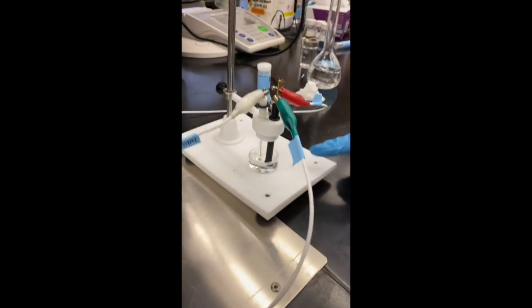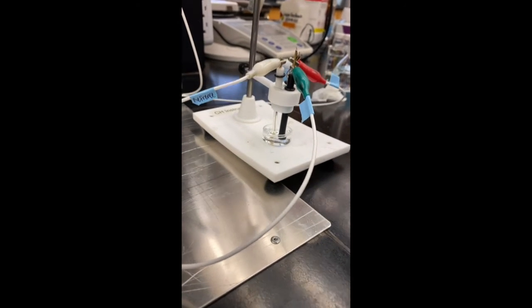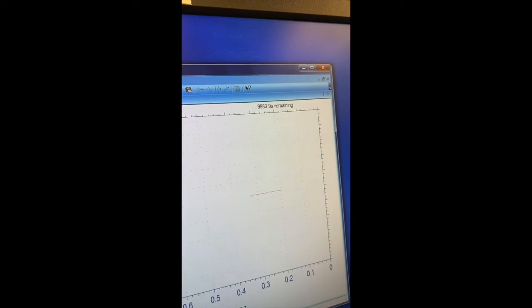Again, check over here on my electrode, make sure everything is submerged, there's no contact between any of the electrodes. Looks like we're good. So now I can come back to the computer and press run. So now I'm going to take note of time, and in 30 minutes I will stop the CV.